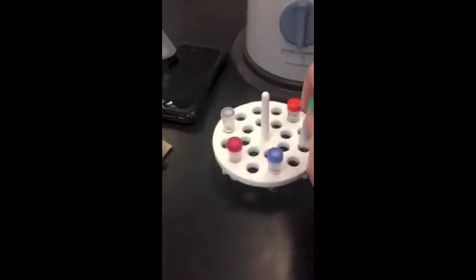If you look at your DNA samples, you're going to see that the DNA is kind of scattered throughout the entire vial. That's the purple stuff in there. And you can see it's on the sides of the vial. There's some at the bottom. We want to get it all concentrated at the bottom, so we get as much of the DNA as we can. So in order to do that, we're going to use this microcentrifuge right here.